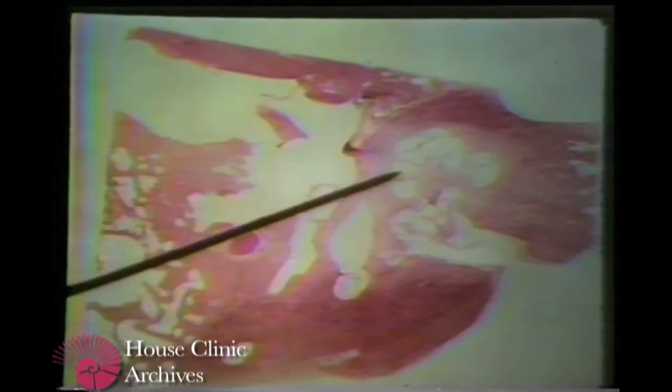The facial recess and tympanic sinus are two very important spaces to the otologic surgeon. For the sake of orientation, here is the cochlea, the tensor tympani muscle, the stapes, the manubrium of the malleus, the posterior semicircular canal. The surgeon enters the middle ear through the facial recess between the facial and the chorda tympani nerve. This allows him a more adequate visualization of this area than he would have through the ear canal.